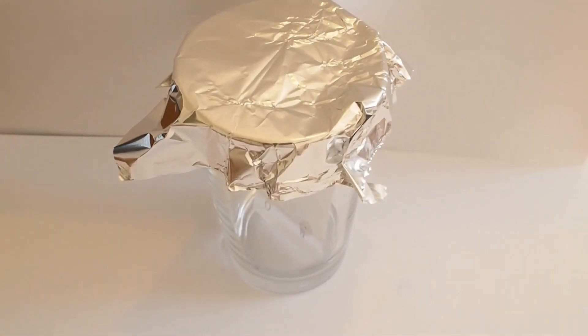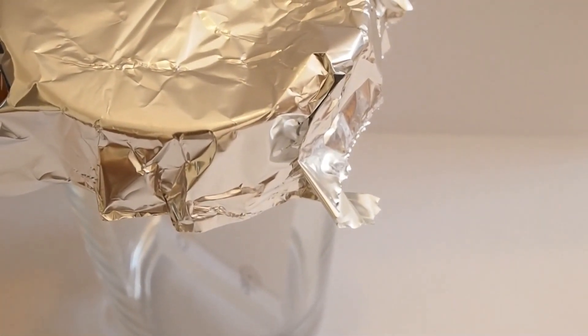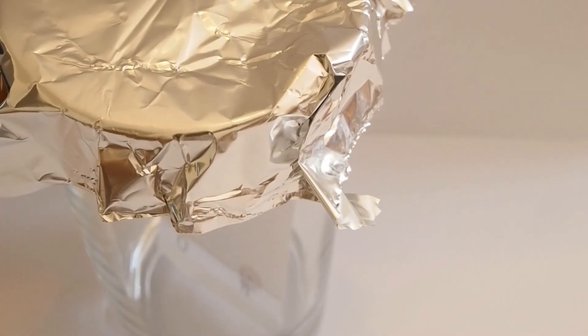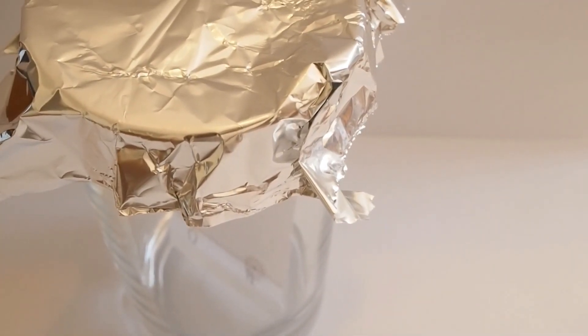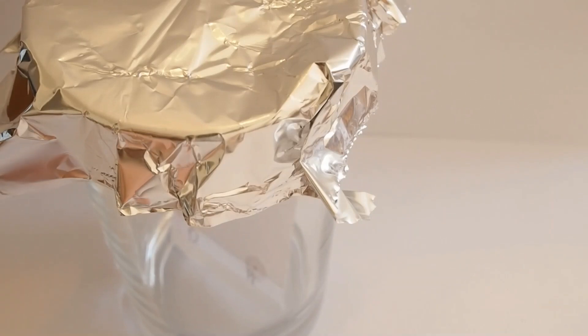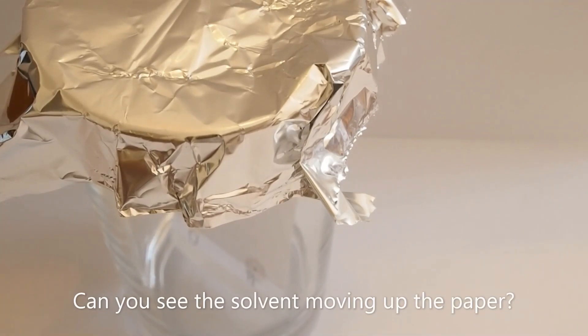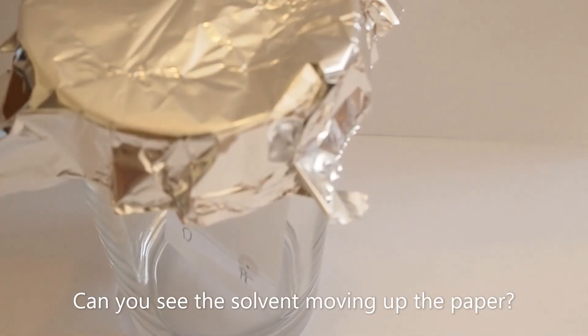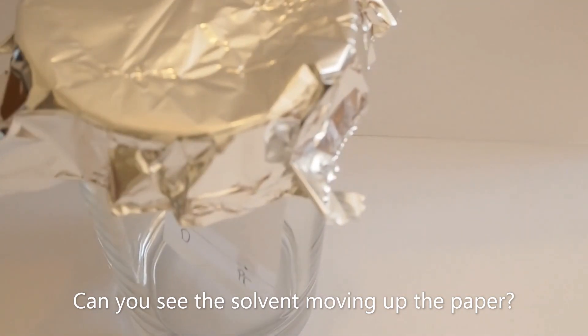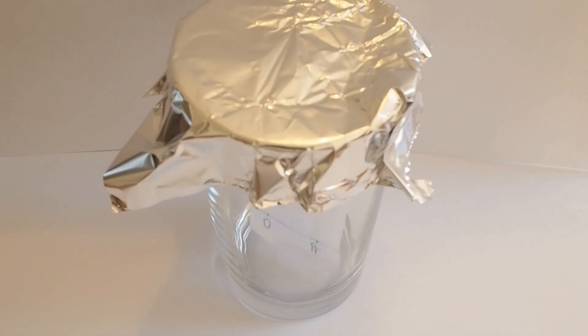Now if you look closely, it's a little bit harder so I'm going to try and zoom in for you. You can see that the liquid is starting to rise up the piece of paper.